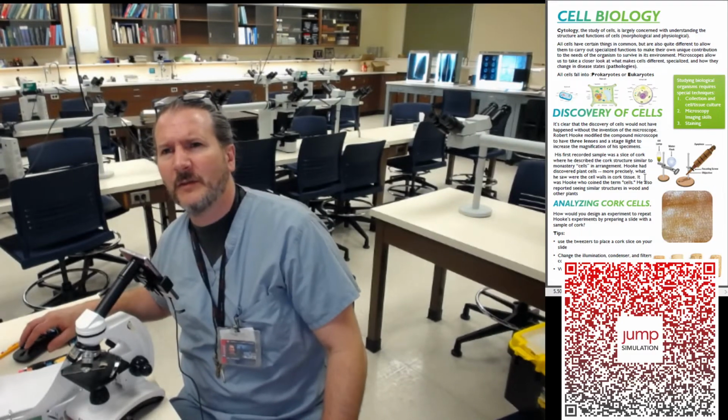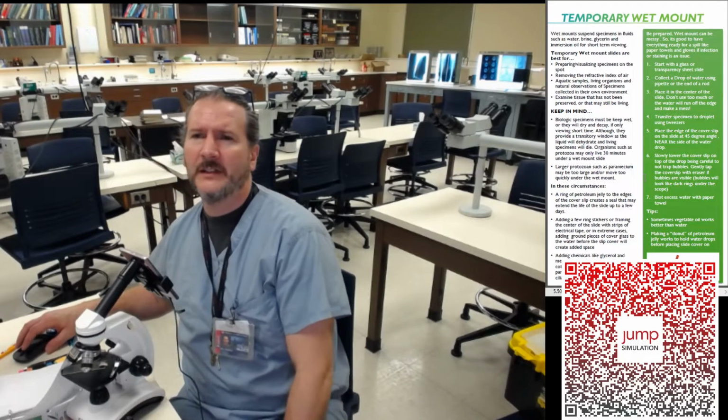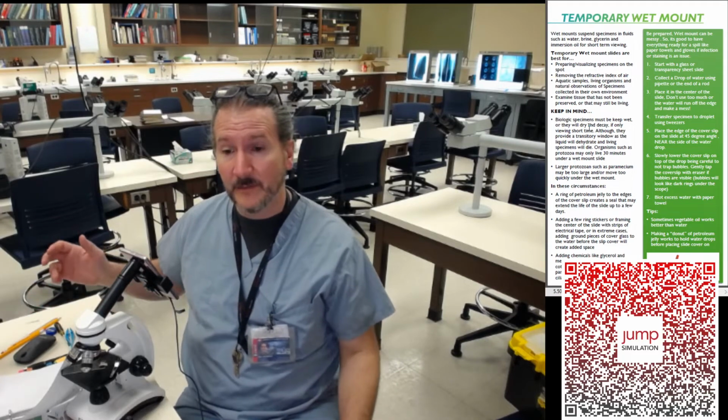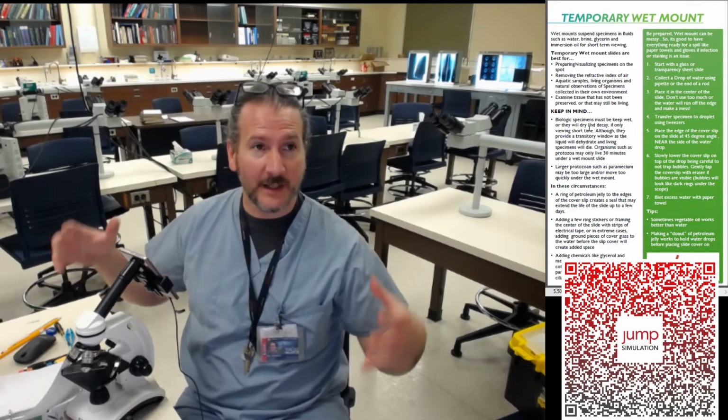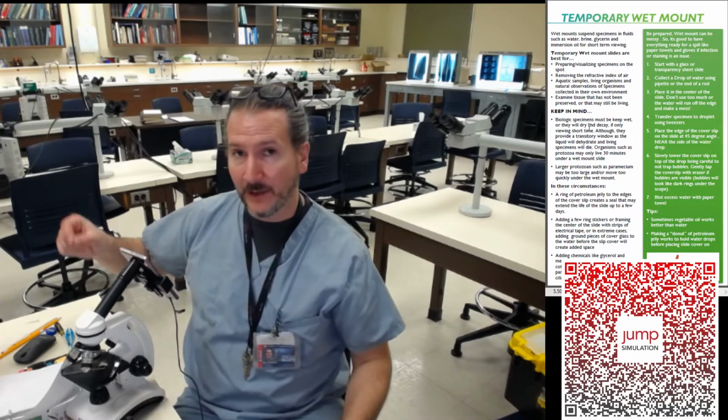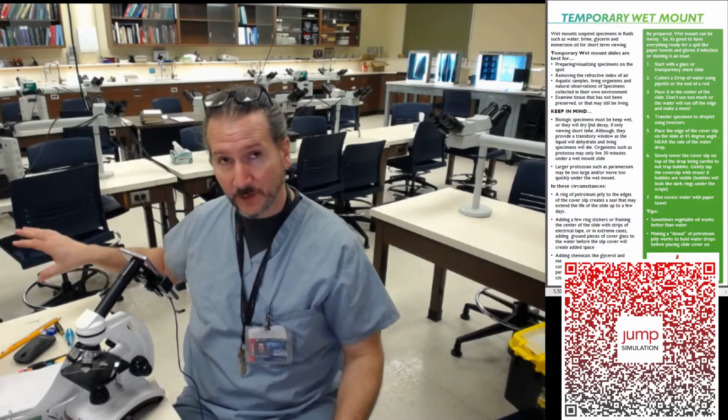Oops. Is that what we want? We want that one. So we did the temporary wet mount. I walked you through it. You can see the different steps. Keep in mind, if you're working with a live creature, organism, that it's going to be hot for them. It's like putting the sun right on you. And you're not going to like it, so they're going to try and get out of the way. The water's going to evaporate at the same time, so you really have a short amount of time to work with them. You can add a little bit more water from their source.